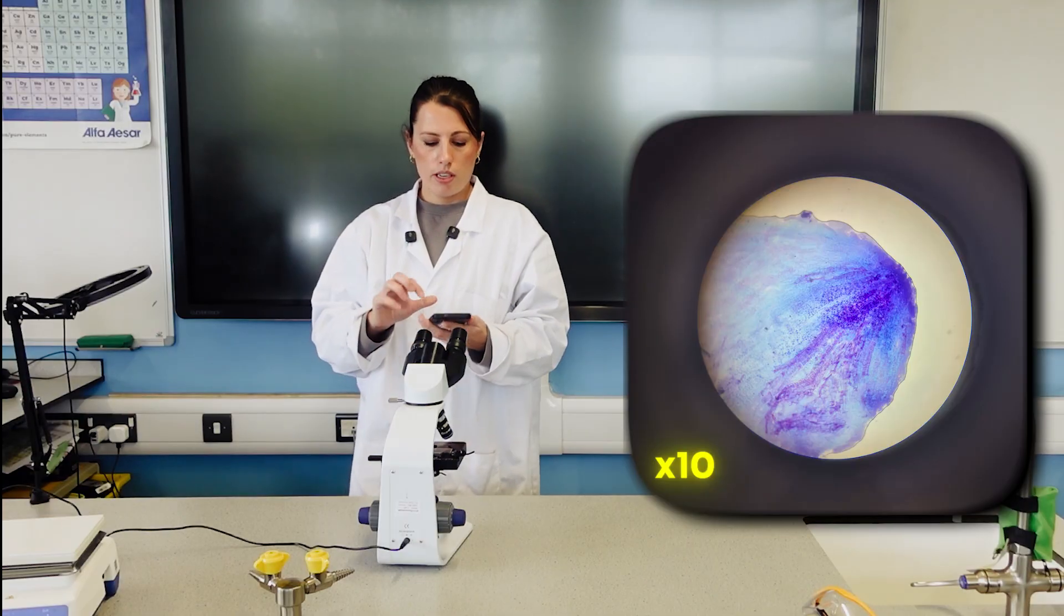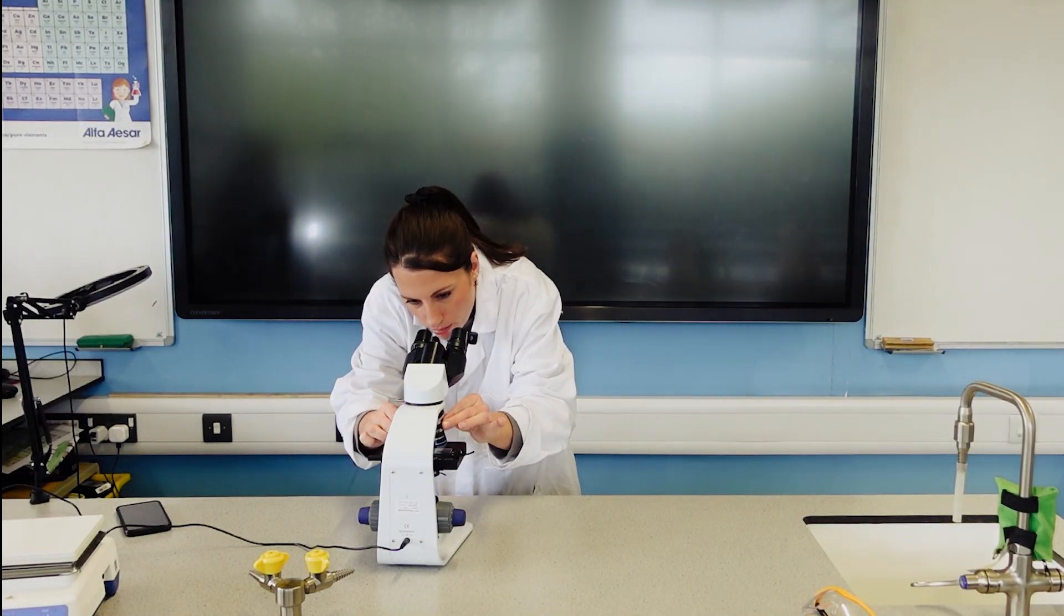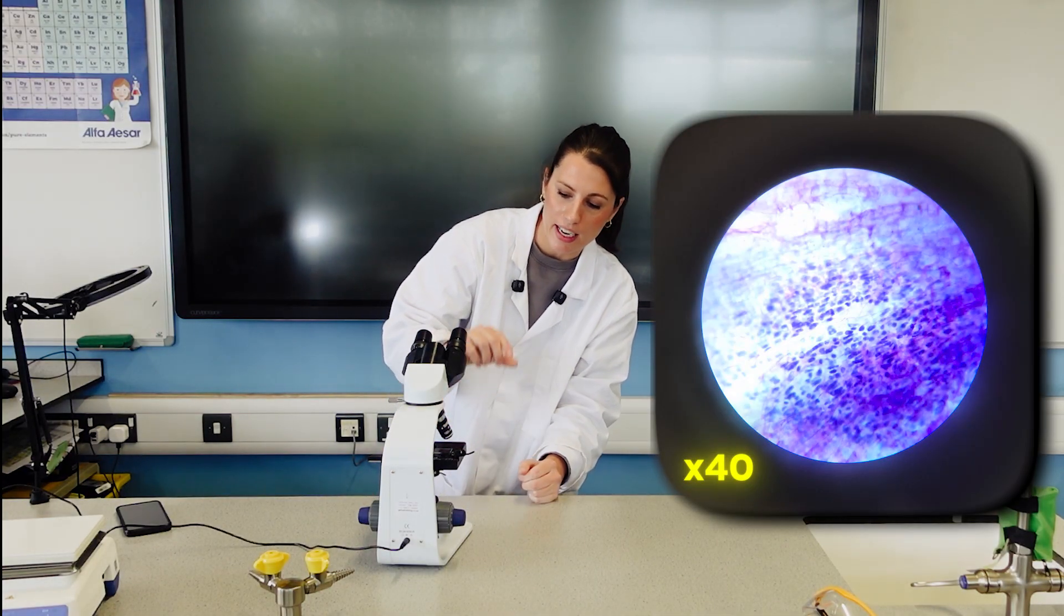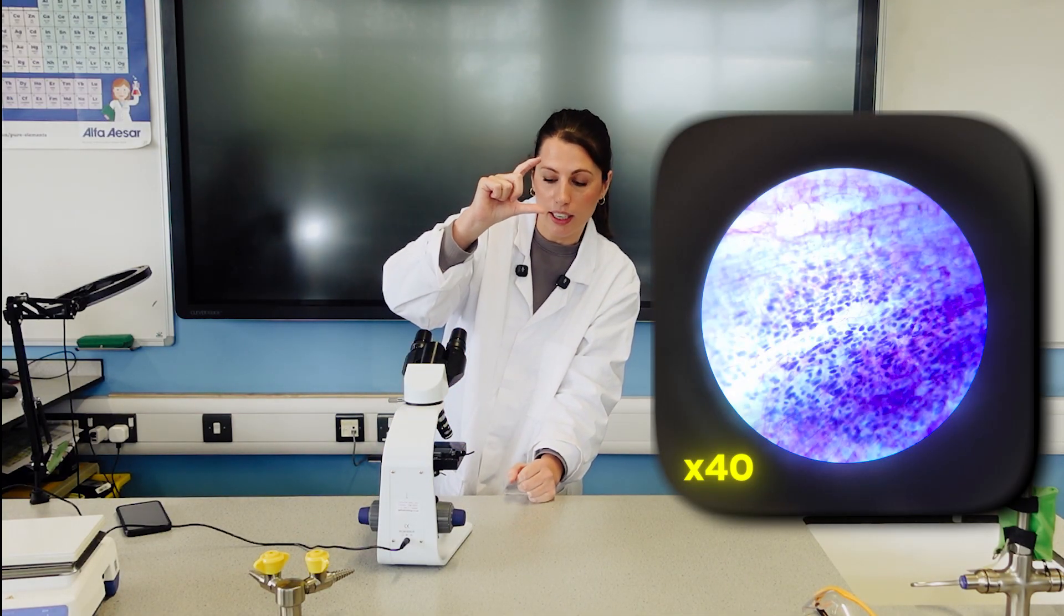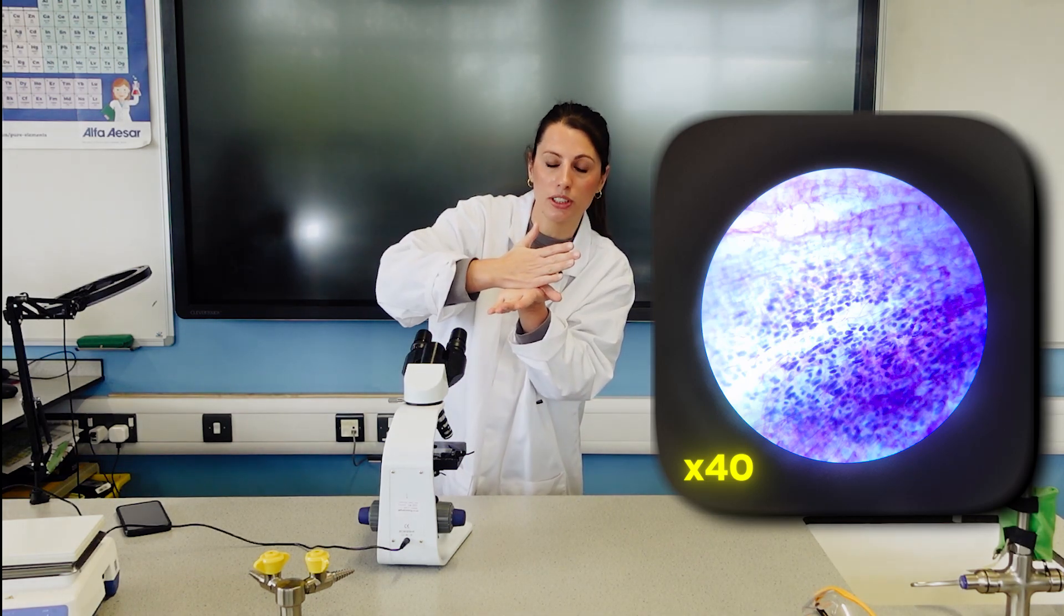I'll just show you what I was looking at. I'm going to move up to a high magnification, 40 times. Let the students know they need to be careful that each of these lenses is longer, so they need to make sure they don't accidentally move the lens down and crush your slide.